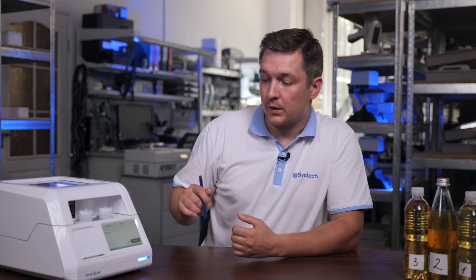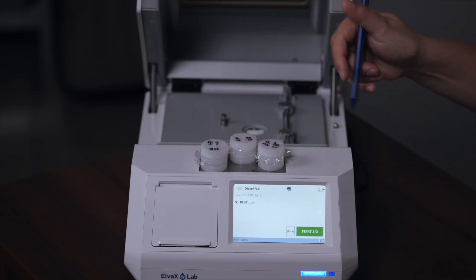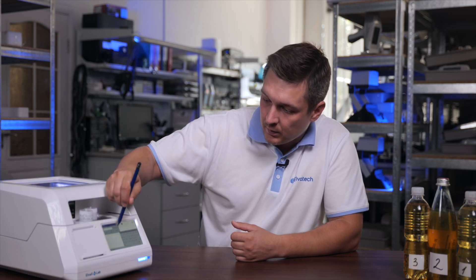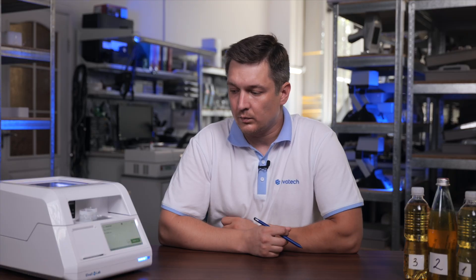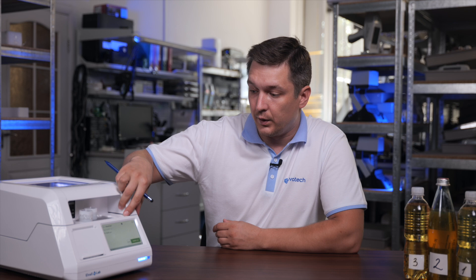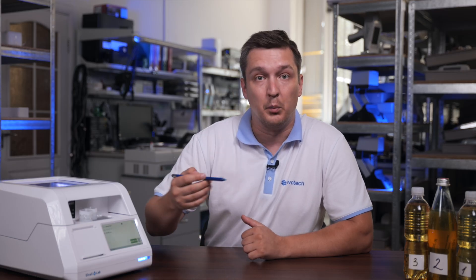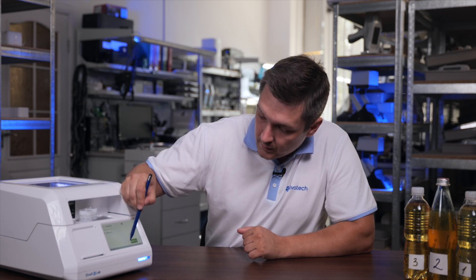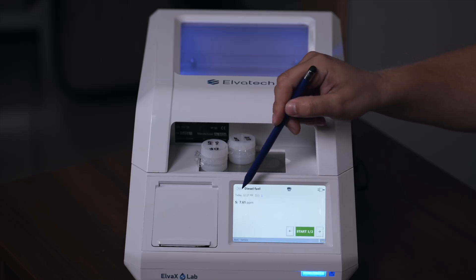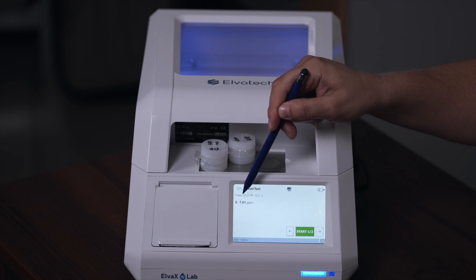Now we see the results of the second analysis. We have completed all three measurements and now we can compare them.